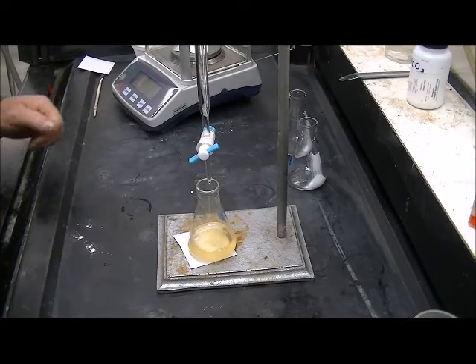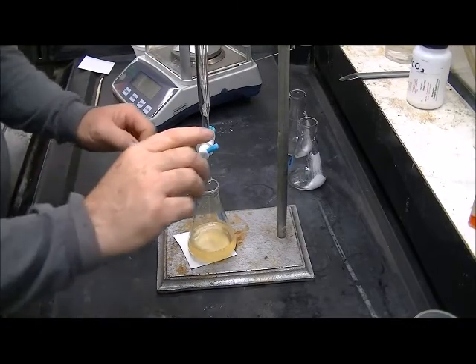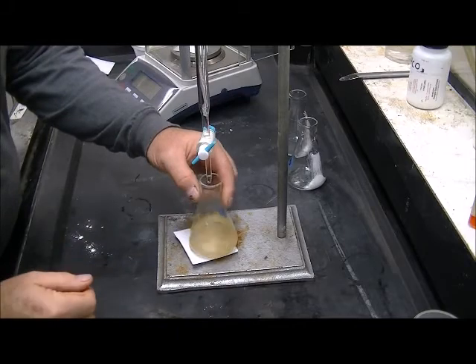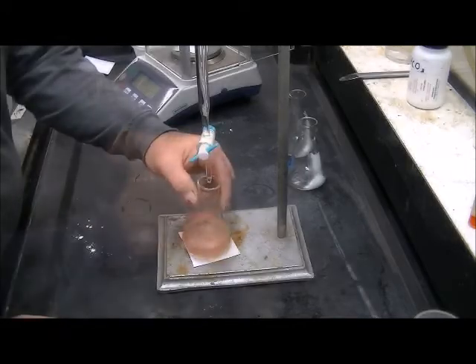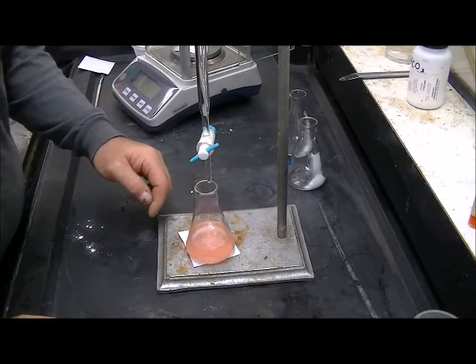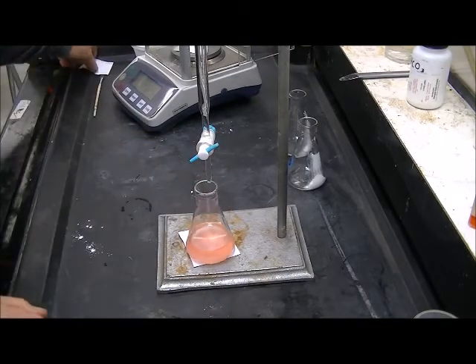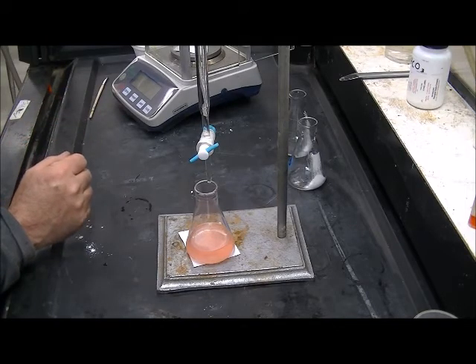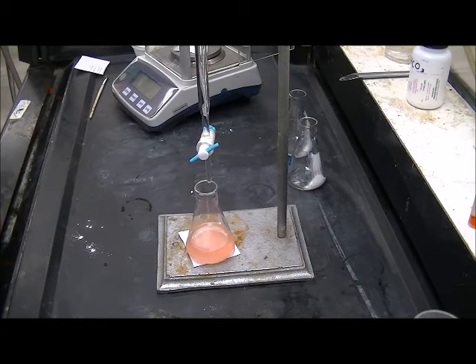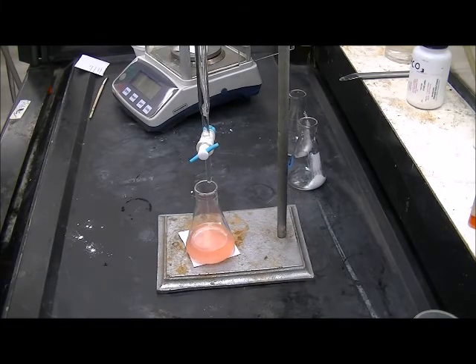This is the first sample of unknown D. And we have our color change at 33.25 milliliters. 33.25 milliliters.